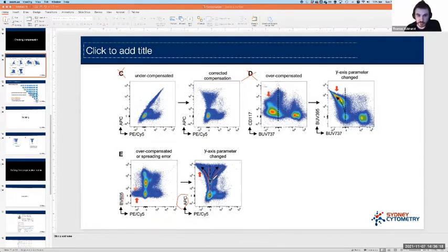The only way we can correct this situation is by going back to our panel design and rethinking what we're trying to do. So that's very important. That's a situation which we can't fix, but we can at least identify, which is important for us. This may not necessarily affect my assay, but that is a lot of spread, and I would probably rather not have that in my life if I had the option. So fundamentally, those are the problems we're going to tackle. We'll have a look at what that looks like in real time.